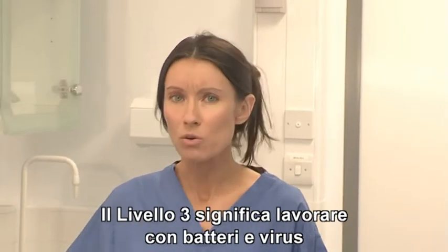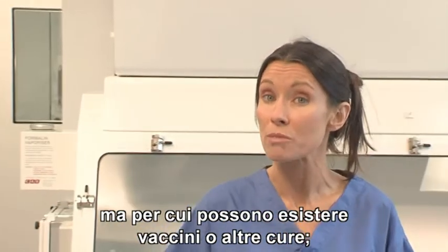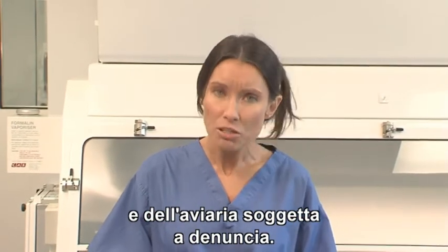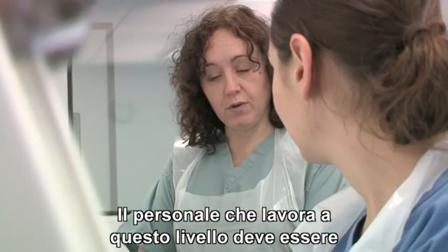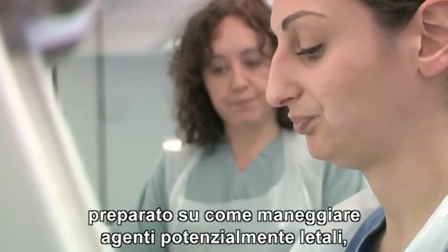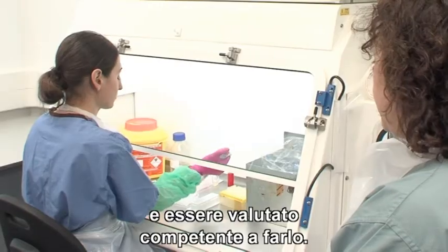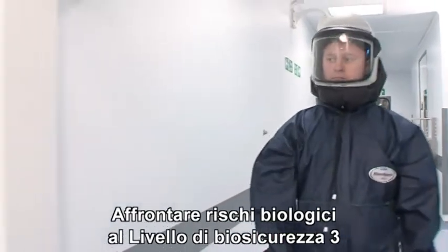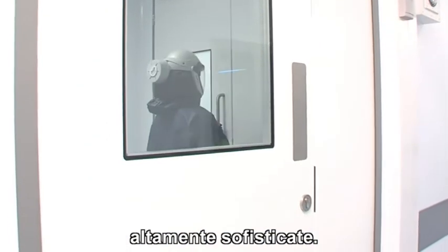Biosafety Level 3 involves working with various bacteria and viruses that can cause severe to fatal disease in animals and humans, but for which vaccines or other treatments may exist. They include virulent Newcastle disease virus and notifiable avian influenza. Laboratory personnel working at this level must have specific training in handling pathogenic and potentially lethal agents, and be assessed as competent to work with these agents. Dealing with biological hazards at Biosafety Level 3 often requires the use of highly sophisticated personal protective equipment.